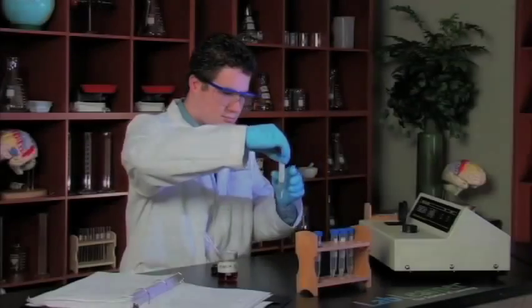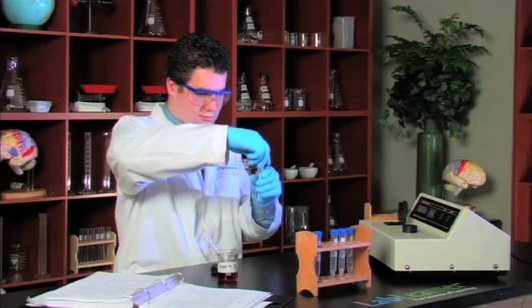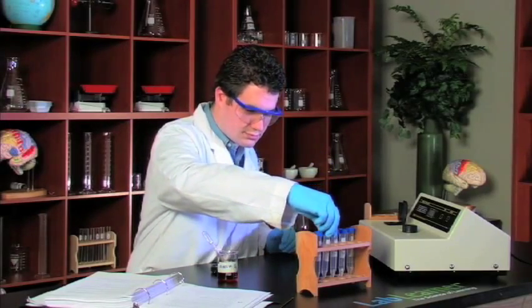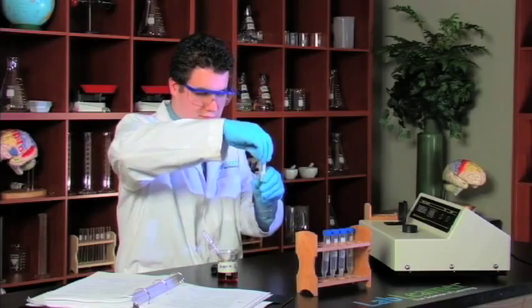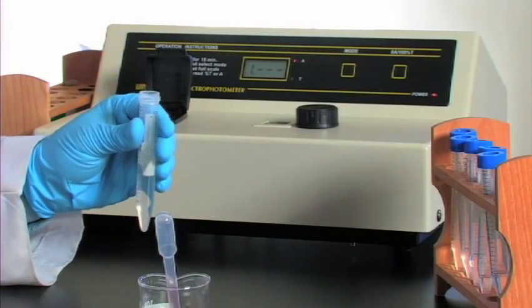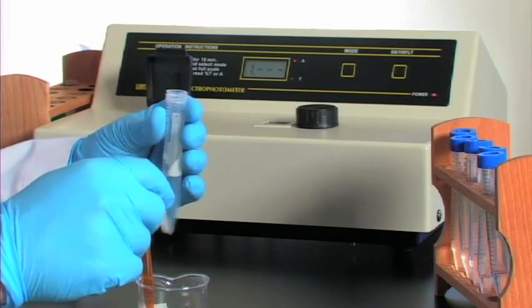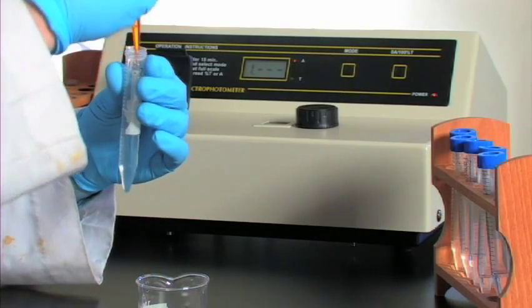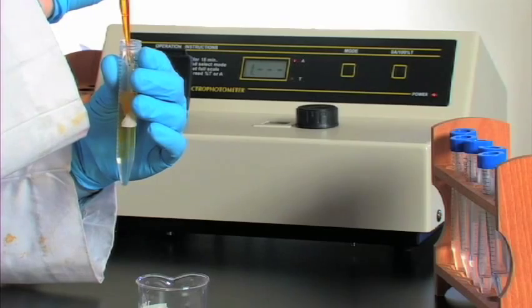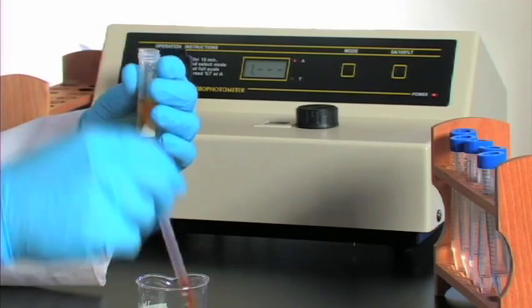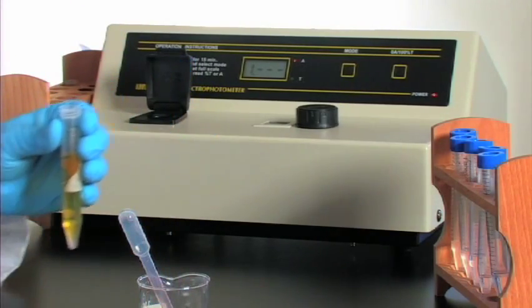We've skipped a few of the readings here and we're at reading number six or trial number six, and this will have the highest concentration of one of the reactants, the acetone. So let's see how quickly this reaction takes place.